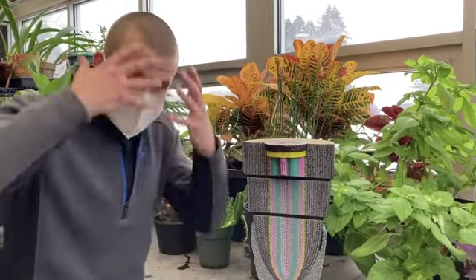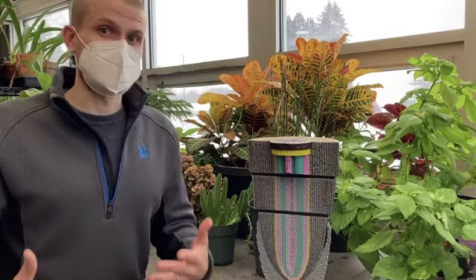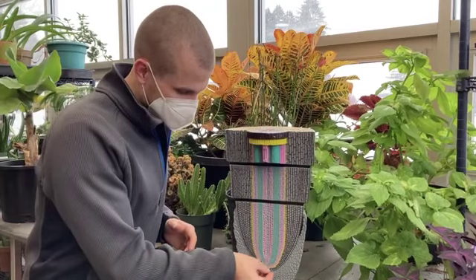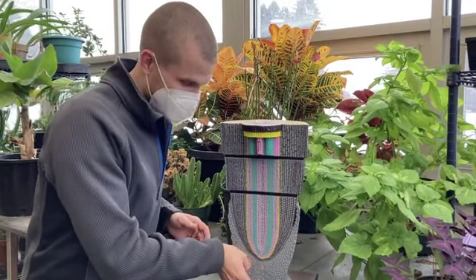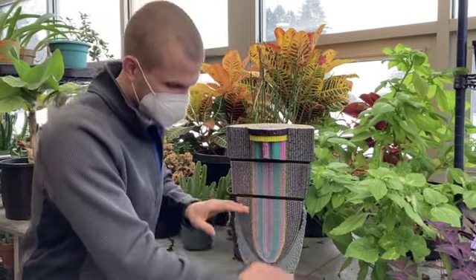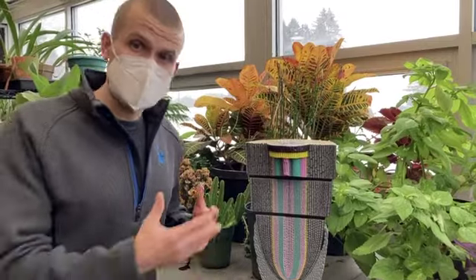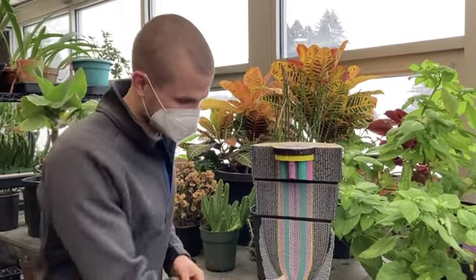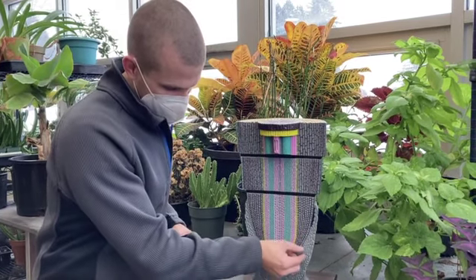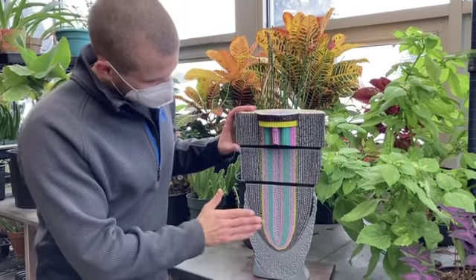So the very outer layers of cells are actually going to die in the process of the root digging deeper and deeper. So your direction of cell division is actually to keep pushing the root cap forward, whereas here the region of elongation is going to be pushing the root cap down. So you have these contrasting directions of growth that help a root grow in the direction that it needs to. So the root cap that's dead is furthest away. You'll have a layer of the living root cap. And then you have our different sections.